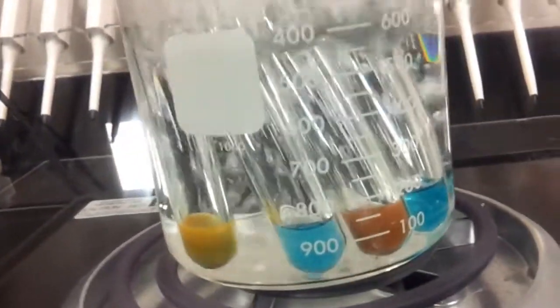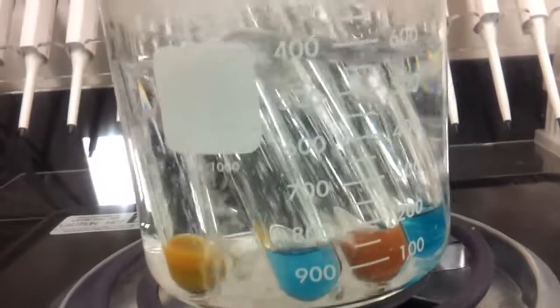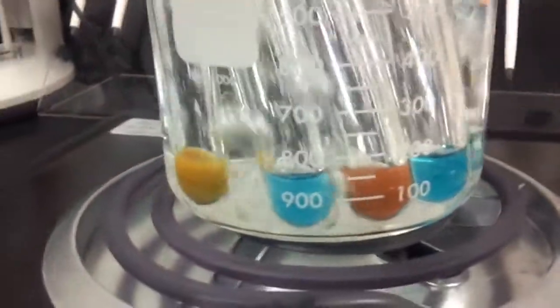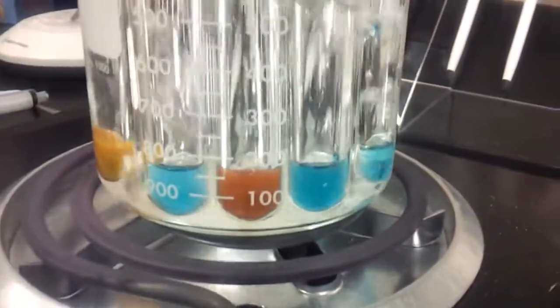So, the solution on the far left is turning a yellow color, and the solution, the third solution, is turning a brick red color.